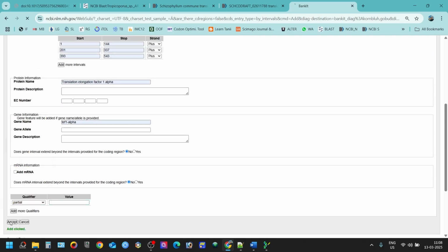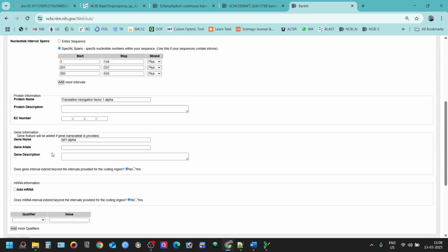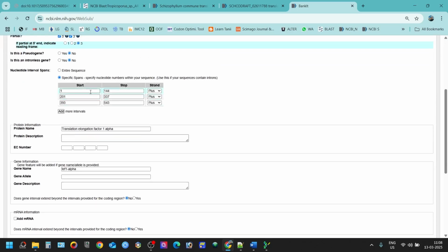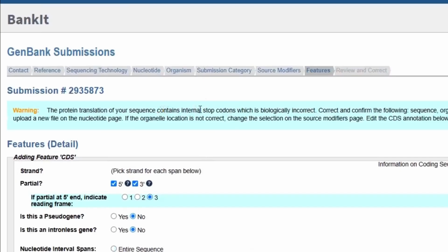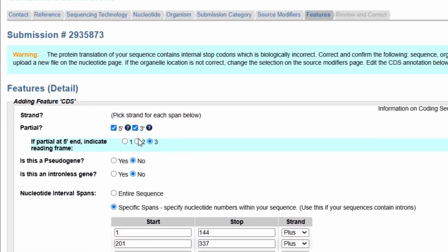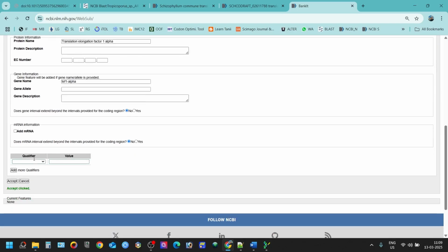You can see something like this will sometimes occur, like everything is correct, you have mentioned correctly the position of the exons, but it is still showing something like "contains internal stop codons," which is biologically incorrect. Then you have to change the open reading frame. In my case, I'm just going to choose one and then accept.